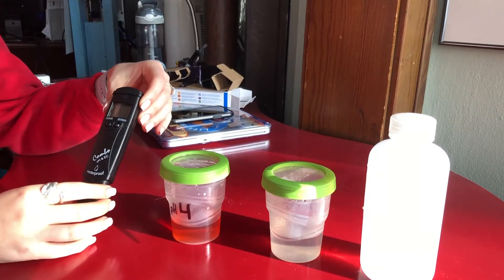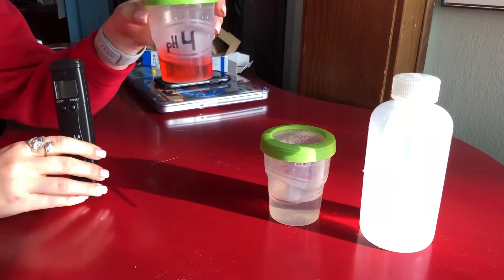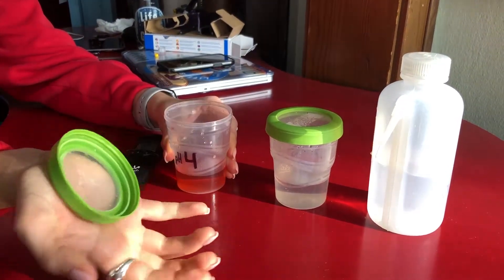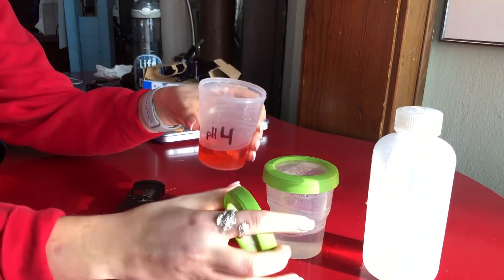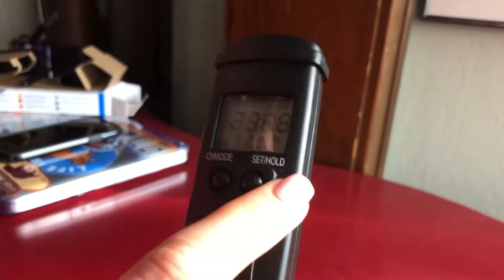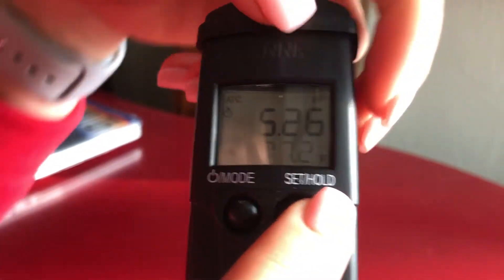We're going to show you how to do a pH calibration with a pH of four. Go ahead and uncap the pH probe — it'll be in a small cup with a little liquid. Turn your pH meter on and it'll show the battery level.